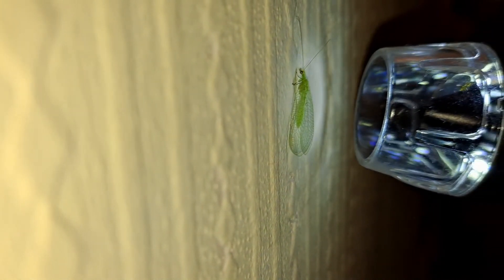I did manage to get the microscope on it and get some rather nice close-ups, having to use one hand for the microscope and one hand for the camera, just so we got the audio as well. I've got a nice shot of the eye — it's got a lump of dirt on the other eye. You'd have thought it would have brushed that off by now.